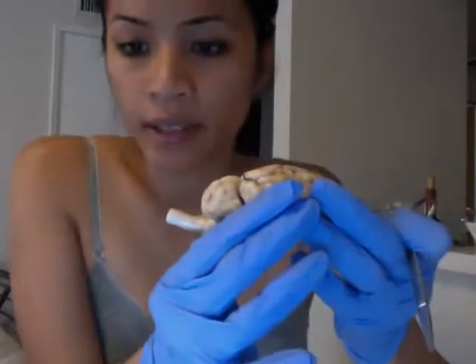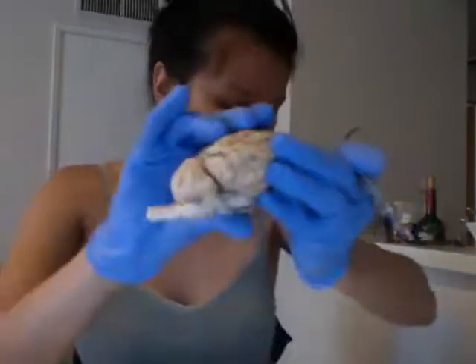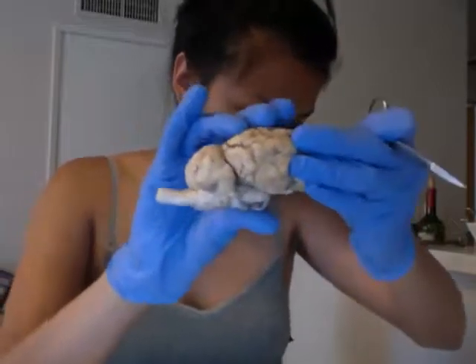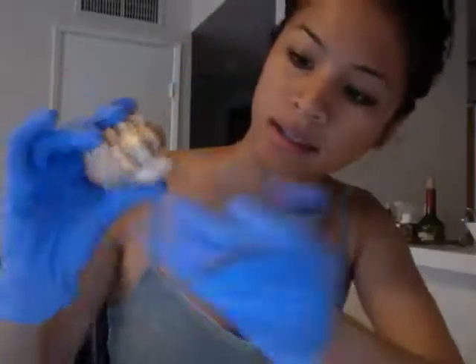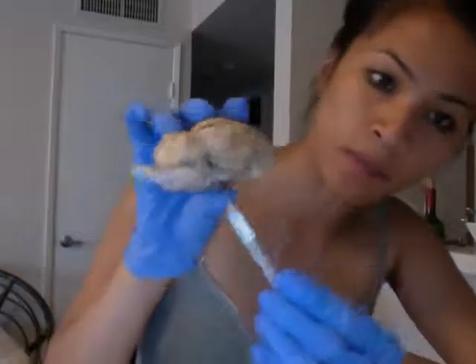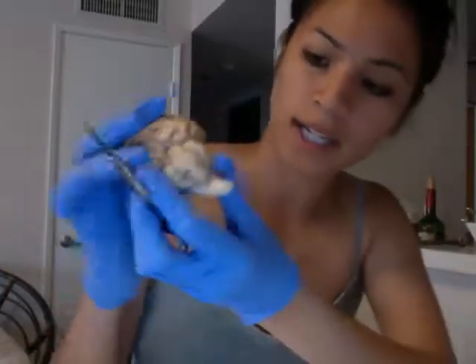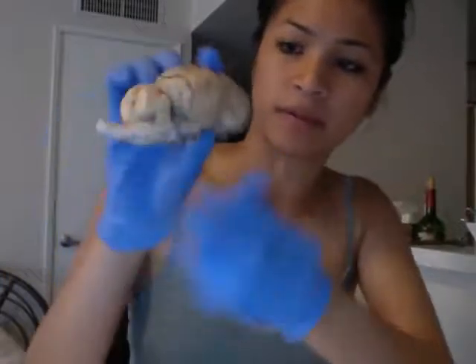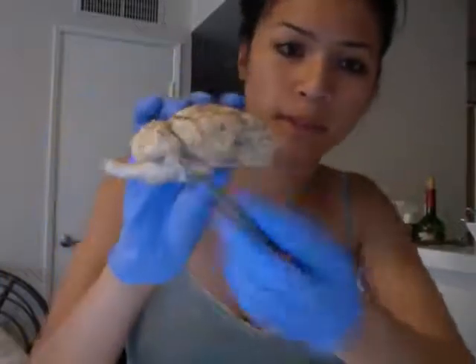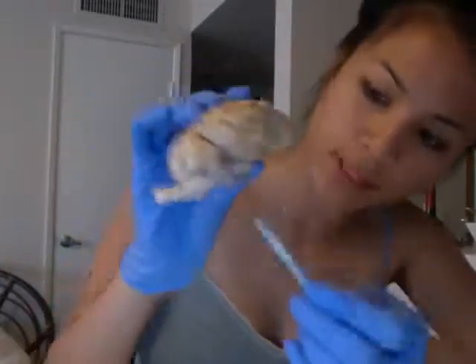Demonstrate the cerebellum. The cerebellum is this part right here. It's kind of hard to identify because the brain is a little dried up, but the cerebellum is right here.